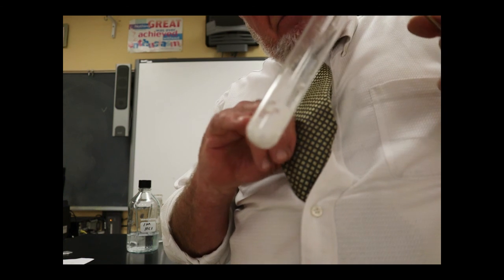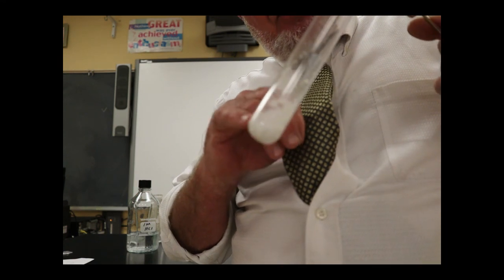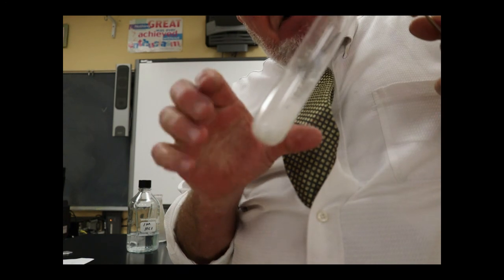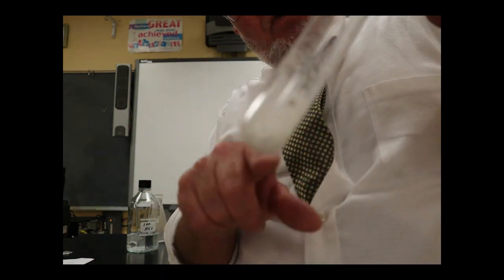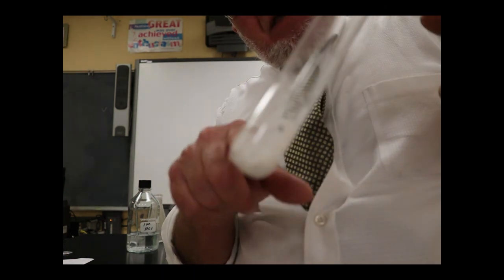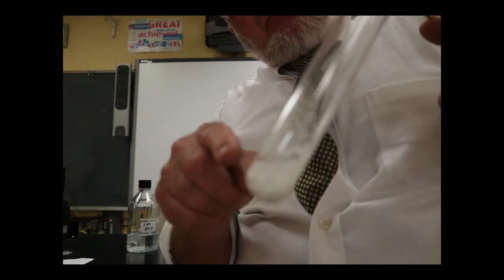They're now not just magnesium with zero charge, which is what the element would be, but magnesium atoms that have 2 positive charge on it, and they're attracted to, combined with, bonded with chloride ions to make this white salt. When this is done and cool, I'm going to mass this test tube. I already know the mass of the test tube. I want to mass the test tube with the material in it, and I'll be able to tell you how much of this I actually got. This will be my actual yield.